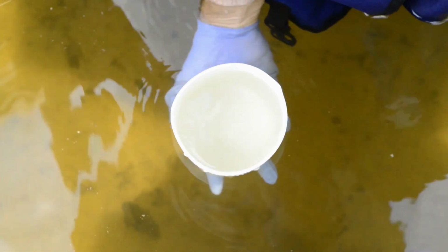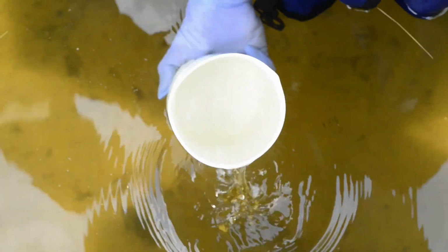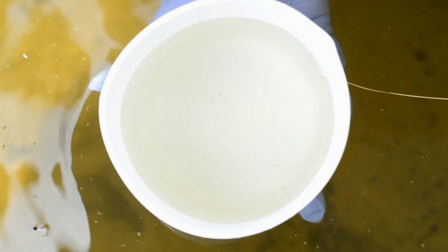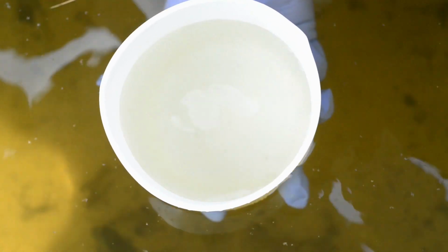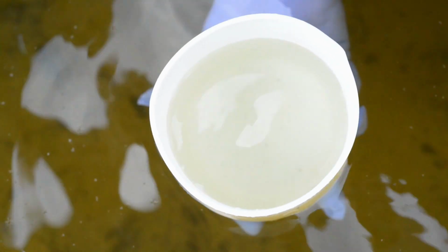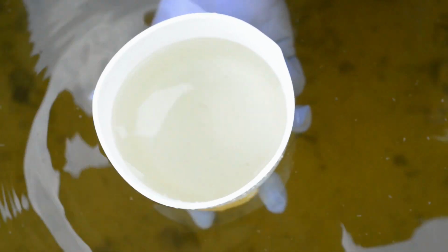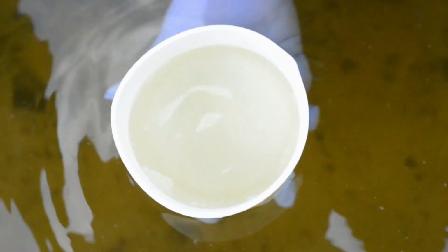We'll give it a minute or two. And if you look at the bottom of the beaker, let's pour off some of this. See what you actually captured. It's quite a bit. And if you're not cleaning off the surface, you're picking up stuff off the surface. So there's a lot of total aluminum in there. And that's something that was on the bottom and not part of the natural background river concentration. It would be part of the sediment concentration. So you can see that settling pretty good. It looked kind of clear in the beginning, but that's quite a bit.